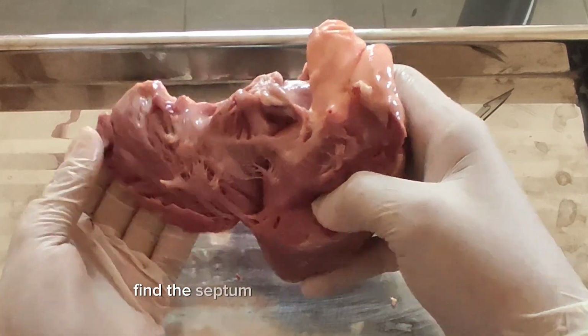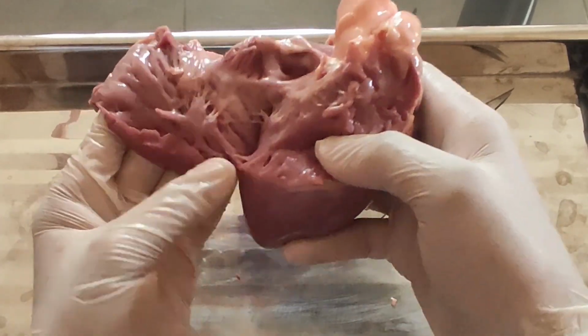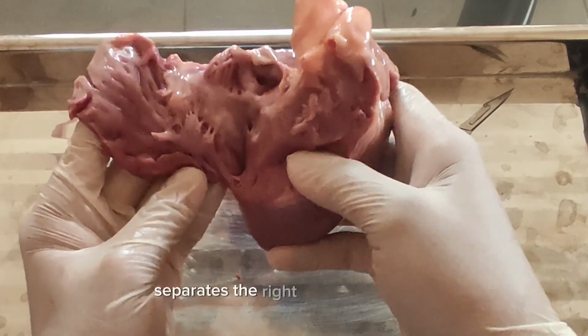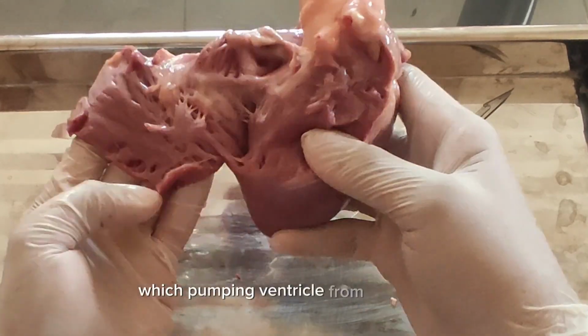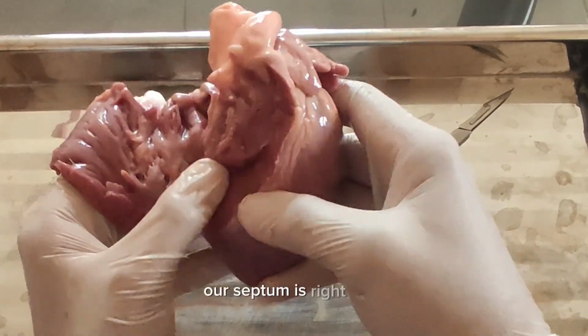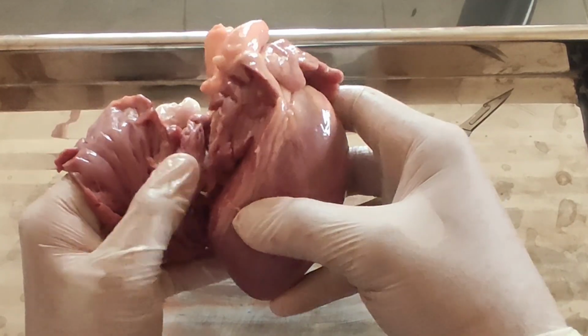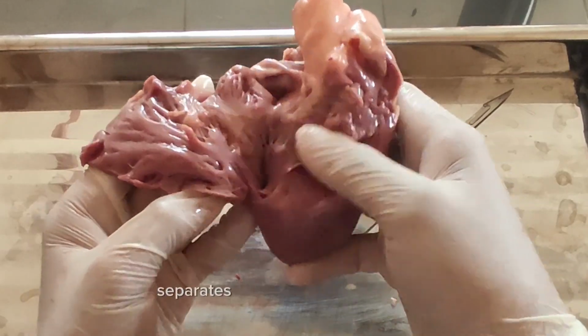Find the septum. We have here the septum, the thick muscular wall that separates the right and left ventricle, the pumping ventricles, from each other. Our septum is right here. It's the thick muscle. The thick muscle right here separates the right and left ventricle.